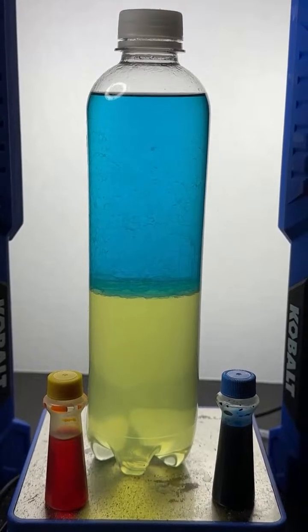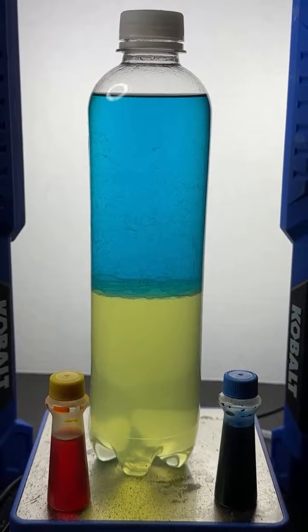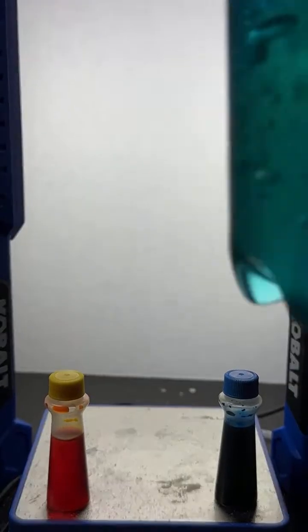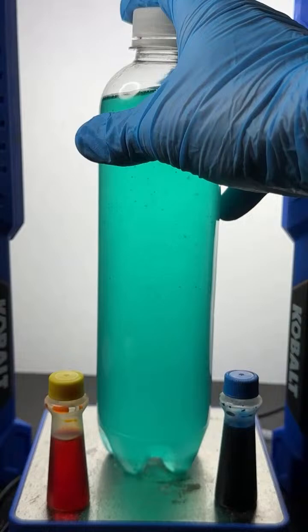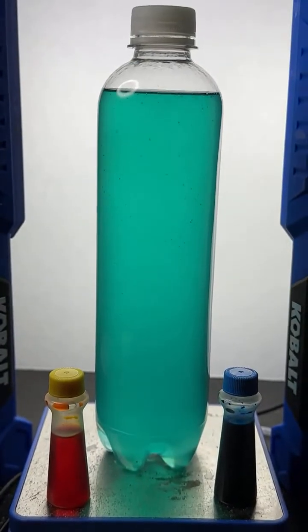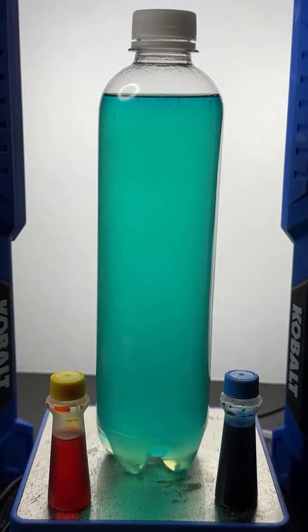NRM wants to know if we can add more colors. We're going to try that, NRM, because I have a second one. Here's a fun, simple reaction. I'll mix this up while I'm reading here. Mix sulfuric acid and potassium permanganate and touch a cotton swab to it. That sounds like a lot of fun, gaming. I might have to try that. Yes, it will work every time I shake the bottle.